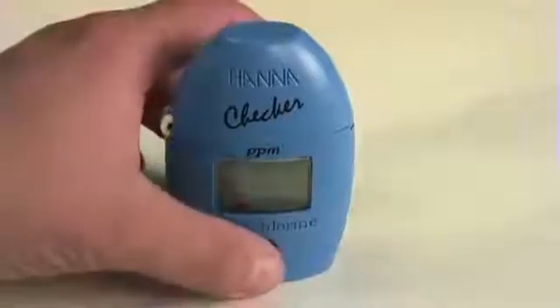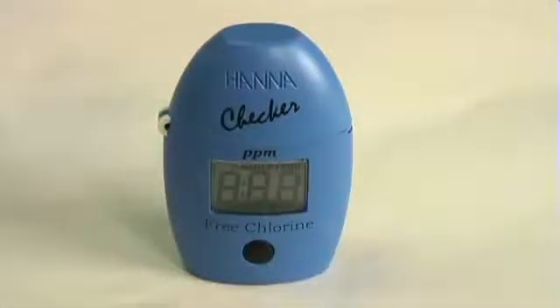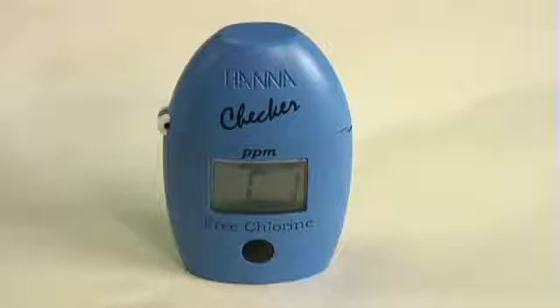With your battery installed, press the button to turn on the meter. This will initially result in all the digits lighting up and a C1 appearing on the screen. The cuvette comes with an indexing system built in — there's a dash and a break between the lines — so you can use that to index your cuvette, making sure that you can get accurate results without having to worry about path length variables with Beer-Lambert.